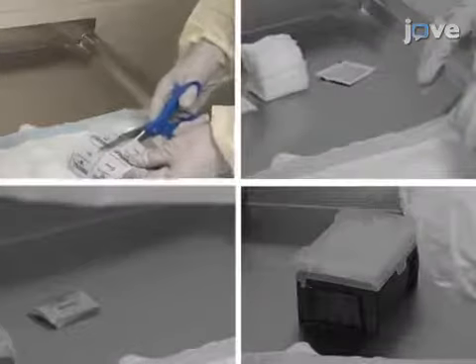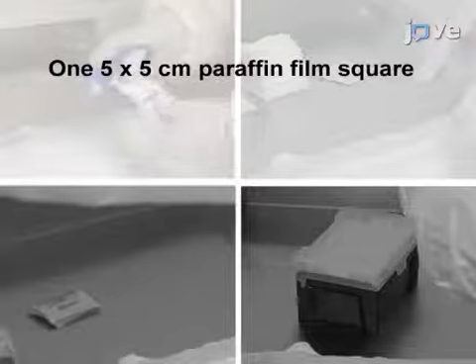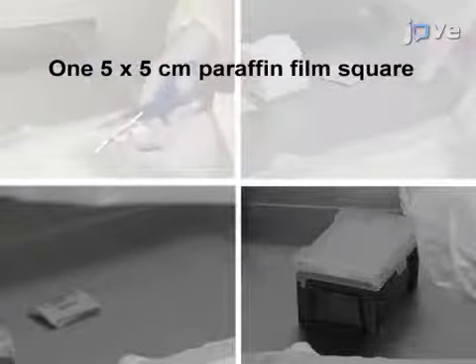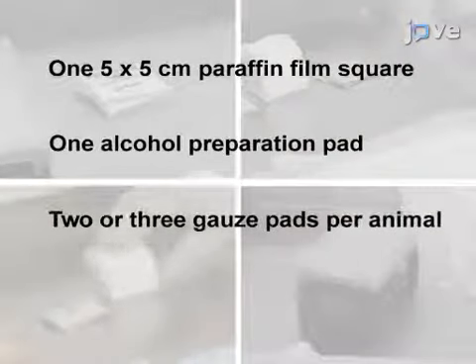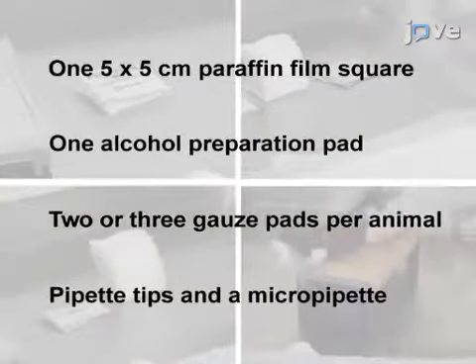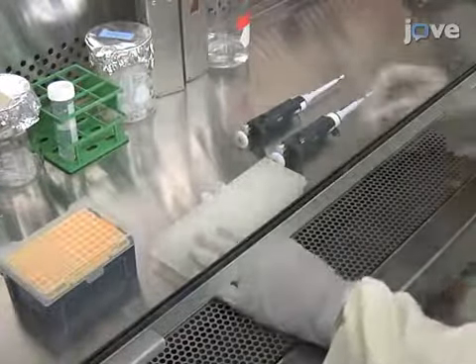Make sure that the following are on hand: one paraffin film square of about 5 x 5 cm per animal, one alcohol preparation pad, and two or three gauze pads per animal, pipette tips, and a micropipette. Then thaw the vector at room temperature and label one sterile microcentrifuge tube for each animal. Pipette the required volume of AAV into the tube.